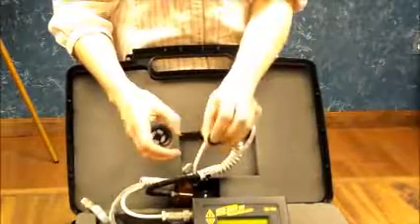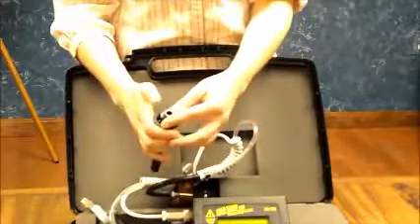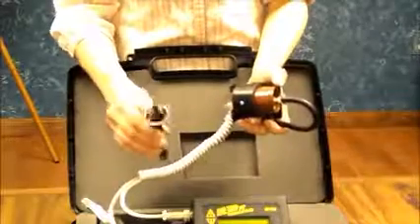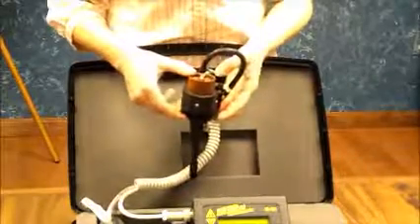The GSA-204 adapter fits into the top of the SKC cyclone. You are going to make sure that the O-ring is actually facing up and simply push it in. Take the SKC cyclone and insert it into the bottom of the sensor. Now you may monitor for respirables.